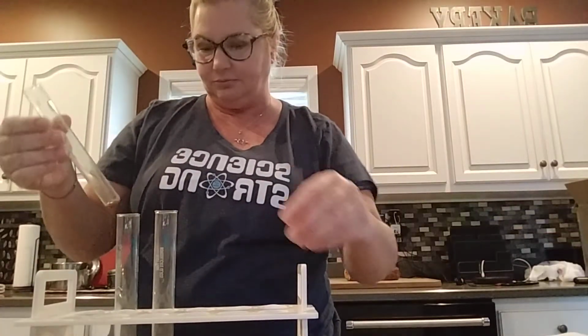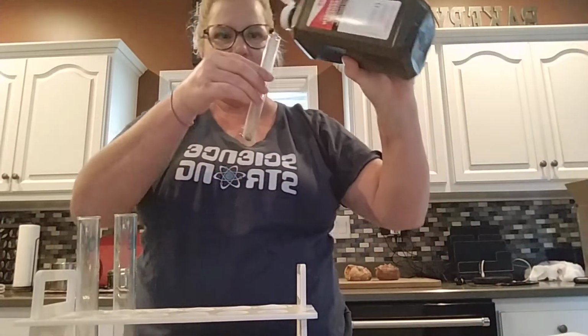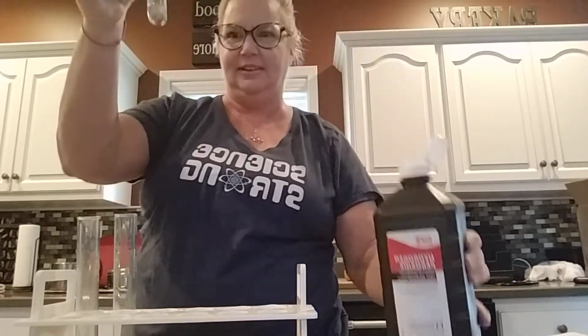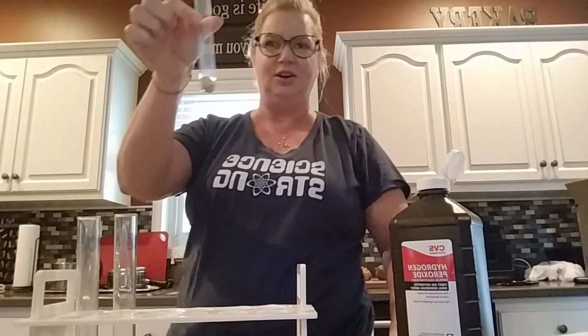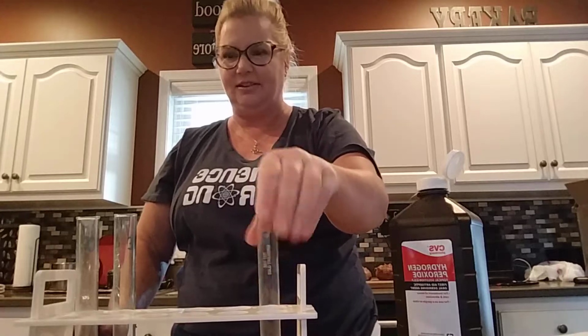So for a 0, that would be it. You see absolutely no foaming, so that would be your 0.